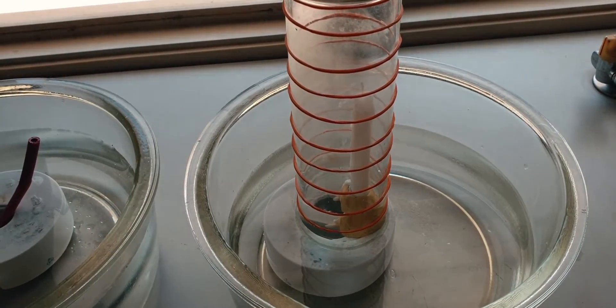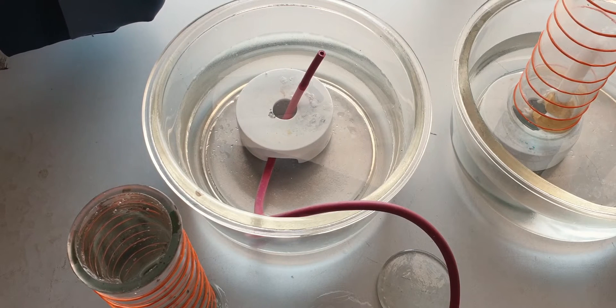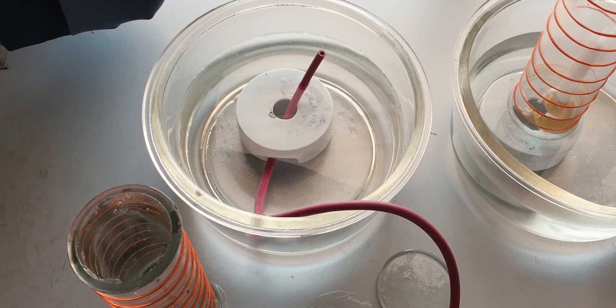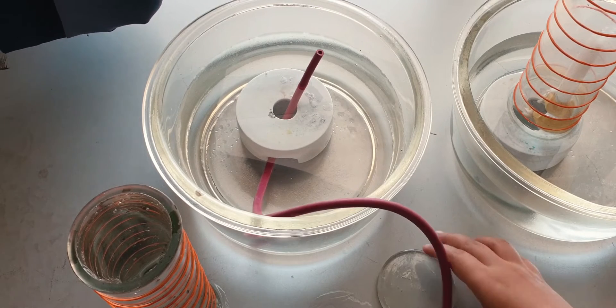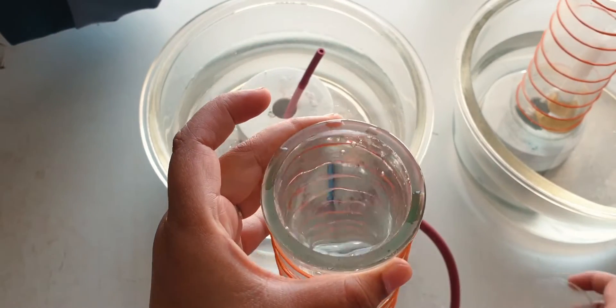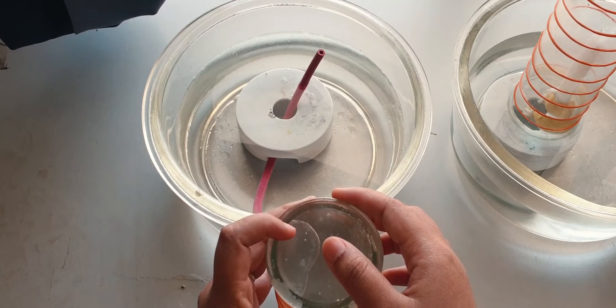Then I'm going to repeat the experiment by using exhaled air. Collecting the exhaled air is quite tricky. What I did was I filled the gas jar full with water and I covered it with a glass cover like that.